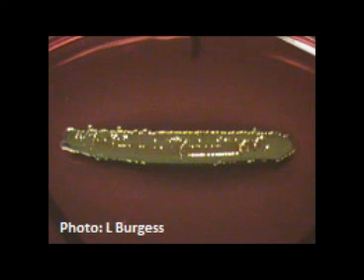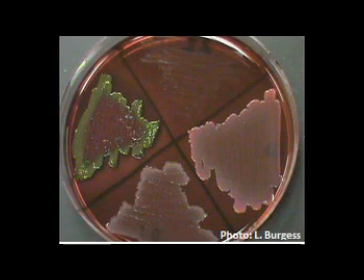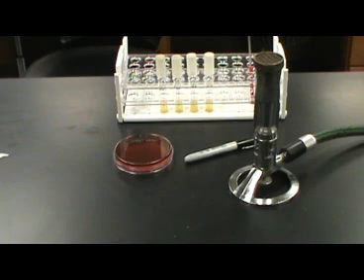Shown here is E. coli, a known fecal coliform. The heavy and rapid fermentation gives off excessive acid waste. The acid waste reacts with the eosin and methylene blue in the media to give the bacteria its metallic green sheen. The EMB test is useful to detect the presence of raw sewage or human waste in environmental samples and is used as a confirmatory test for the presence of fecal coliforms.